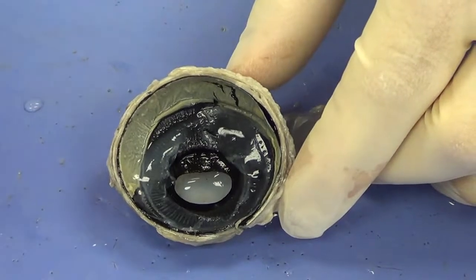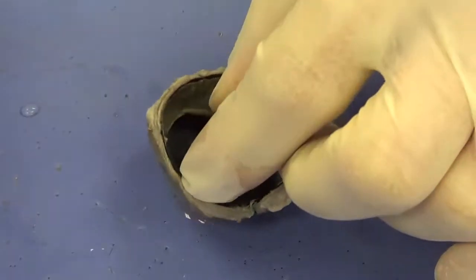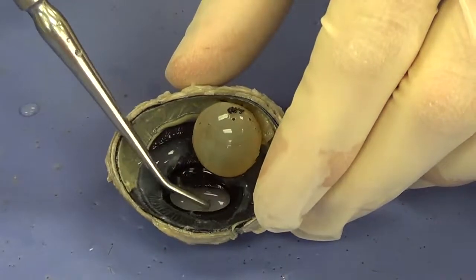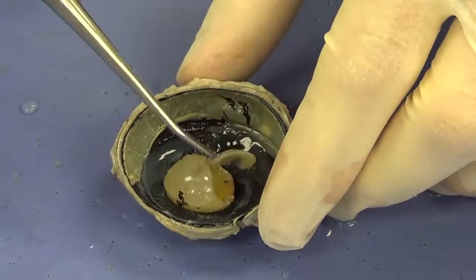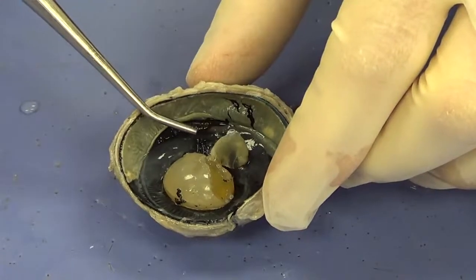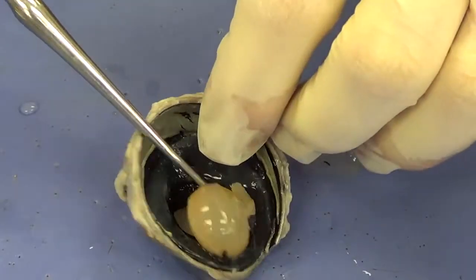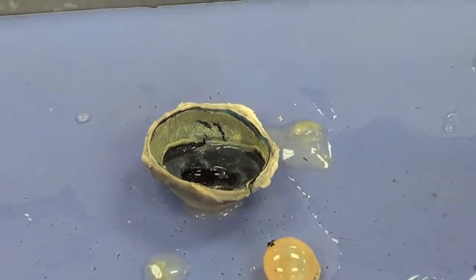Now I want to go over one more thing, and that was if I take the lens and replace the lens back in the eye, anything anterior to the lens, meaning where my probe is located, is referred to as the anterior cavity. Anything posterior, where my probe is located now, is called the posterior cavity. The vitreous humor is in the posterior cavity. And that's going to be it for the cow eye dissection.